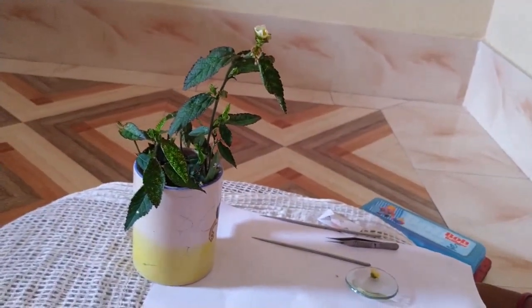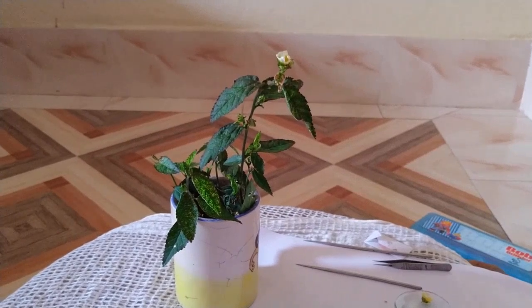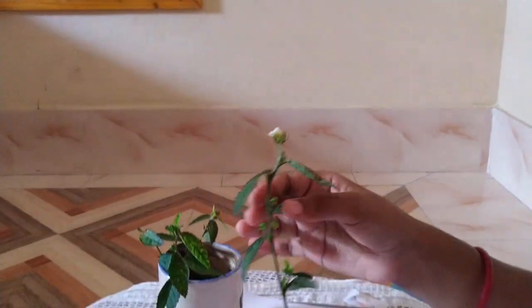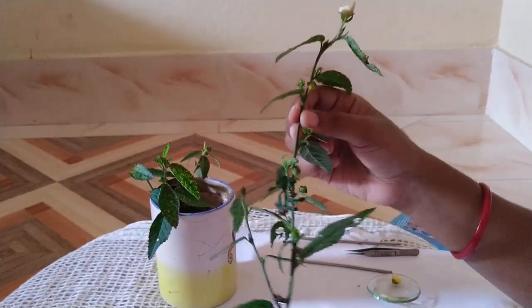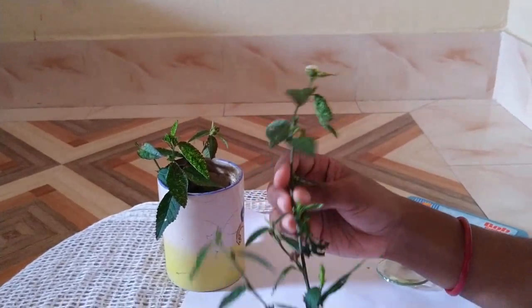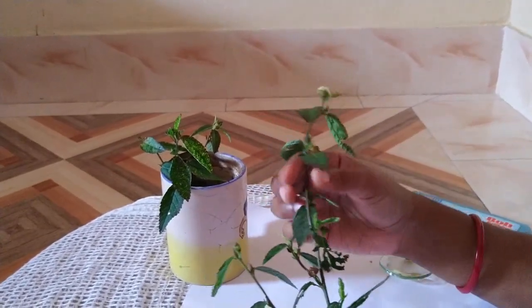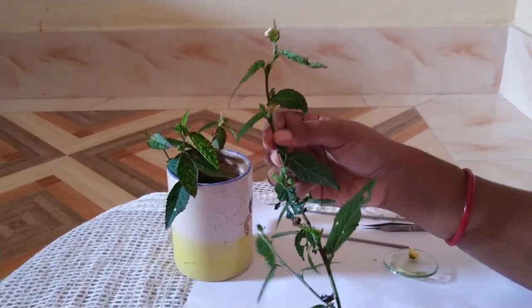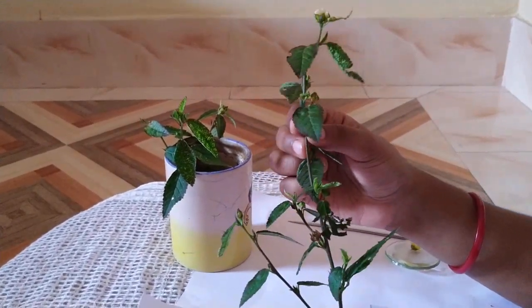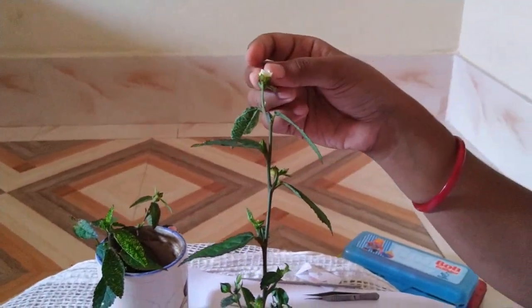In this syllabus we have one family, that is Malvaceae. Under this family, we have to dissect a few plants. Today, we will try to dissect one plant that belongs to the Malvaceae family, that is Sida. That is a single twig of Sida. Morphologically, its habitat is terrestrial, and I have collected it from Moshin College and the adjacent area. Its stem is actually erect, and the leaves are alternately arranged.